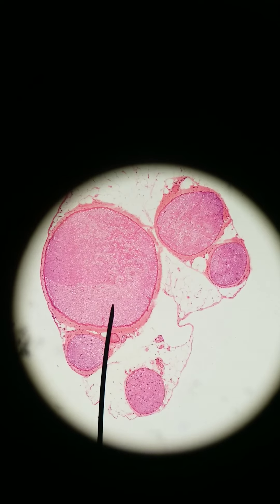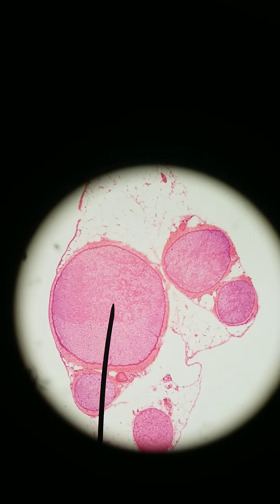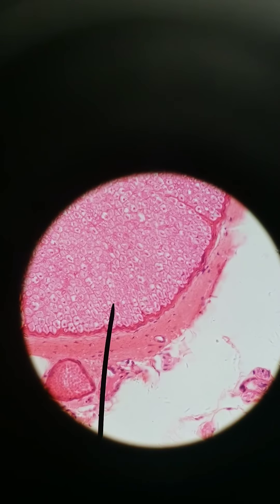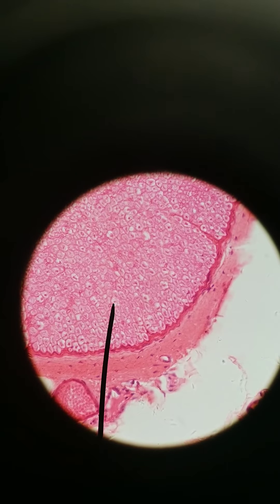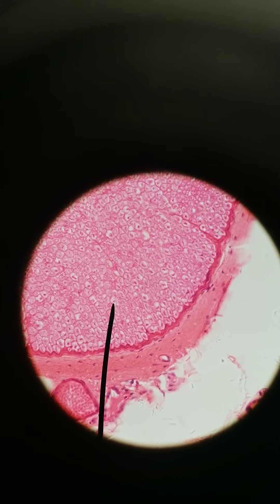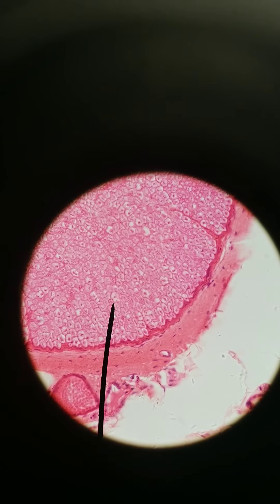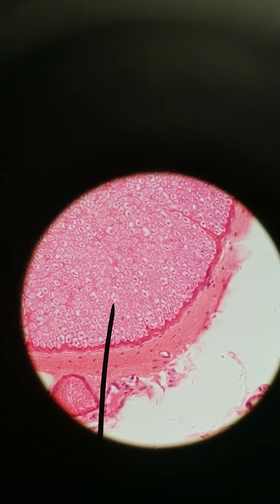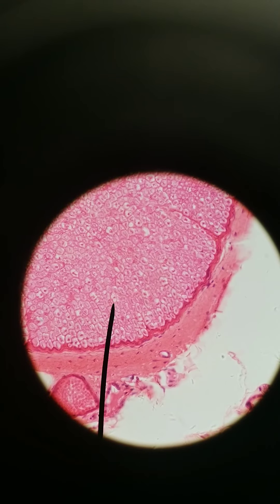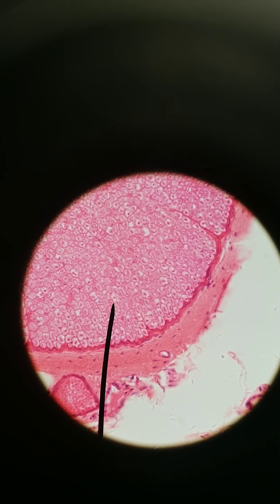Here we are at 100x, and we've got a bunch of nerves — about five nerves in cross-section. Let's zoom into one at 400x. Each one of these dots is an axon, and the white space surrounding that dot is the myelin. The small line encircling the white space is called endoneurium — the connective tissue that surrounds every single axon in the periphery, just like endomysium covers every single muscle fiber.